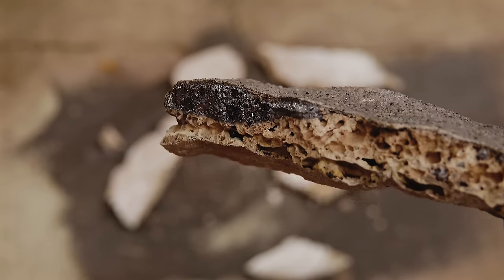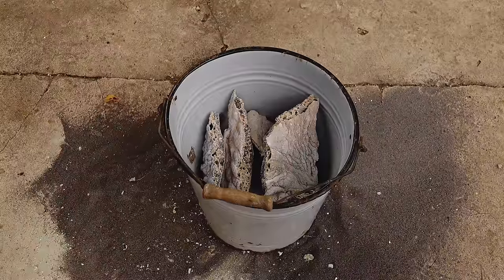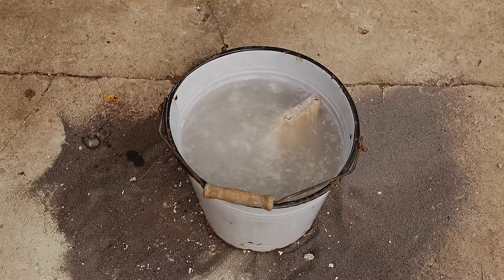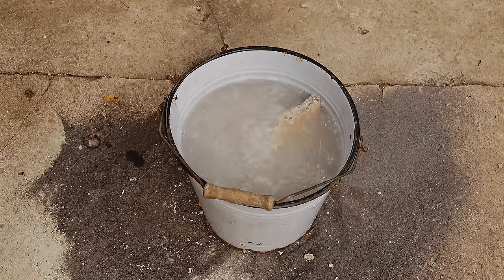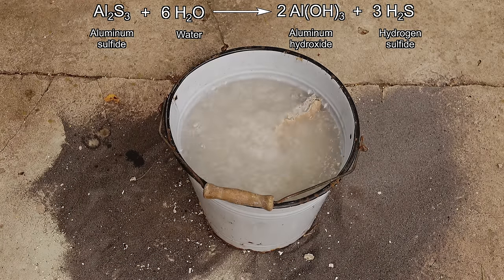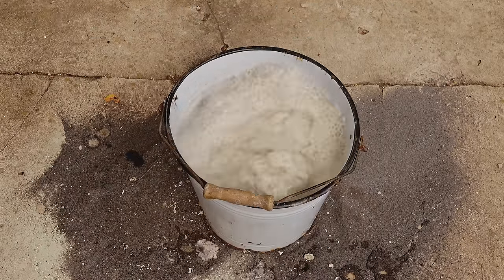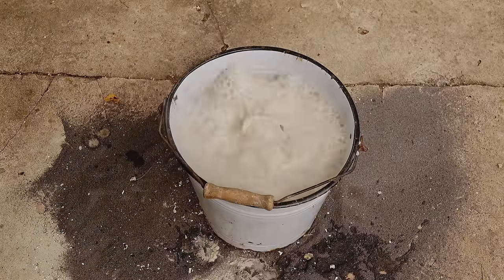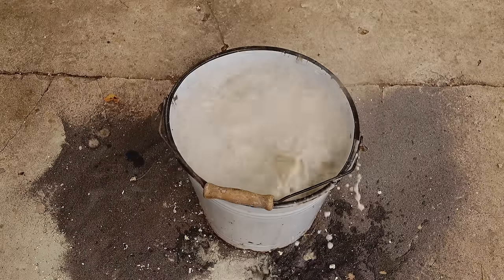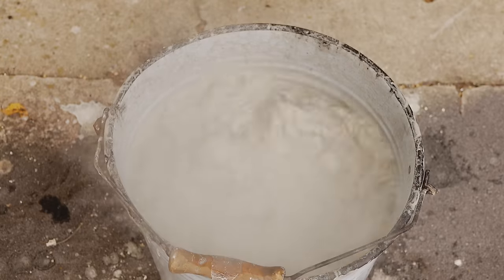To start the cleaning process, I got the whole crushed slab into my good old bucket and poured in another bucket's worth of water. Almost immediately after the addition, a ton of gas bubbles started being emitted and a horrible stench filled the entire area. The reaction going on here turns aluminum sulfide into aluminum hydroxide and hydrogen sulfide, which is really smelly and really deadly. I wore a good gas mask for the entire duration of this process to not kill myself, because hydrogen sulfide has this fun property of losing all its smell if the concentration gets too high. The reaction only seemed to get more and more vigorous, looking like some kind of an evil witch's cauldron. It also produced enough heat to make the water boil, which made it even more angry than it already was.